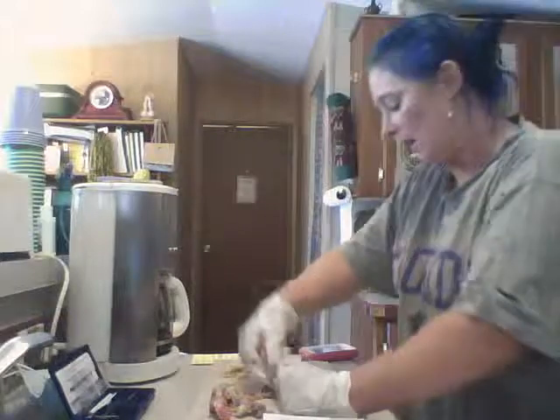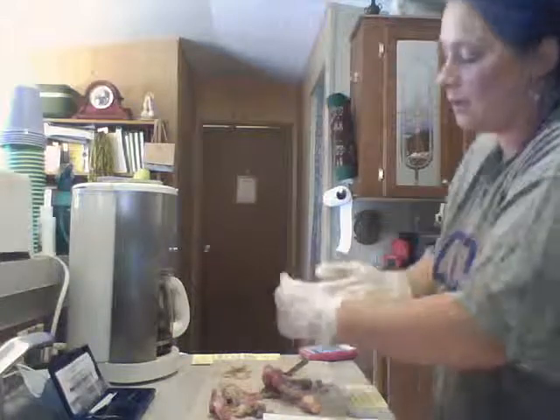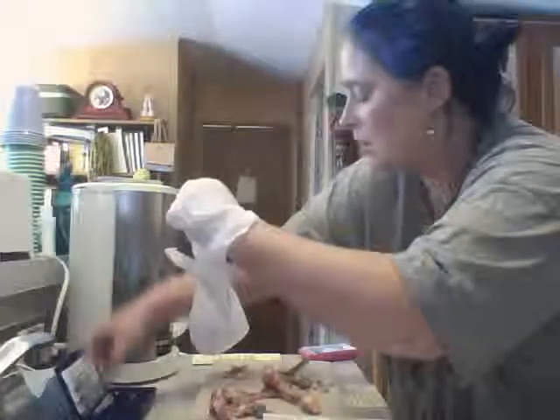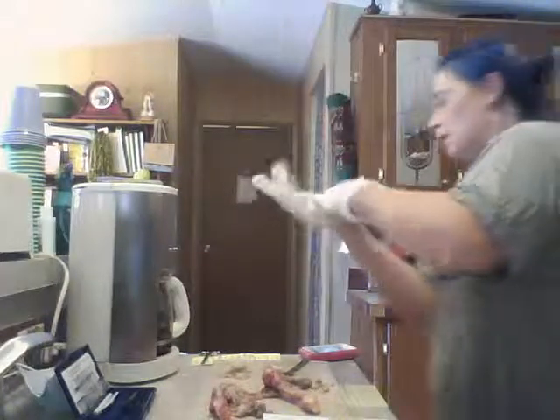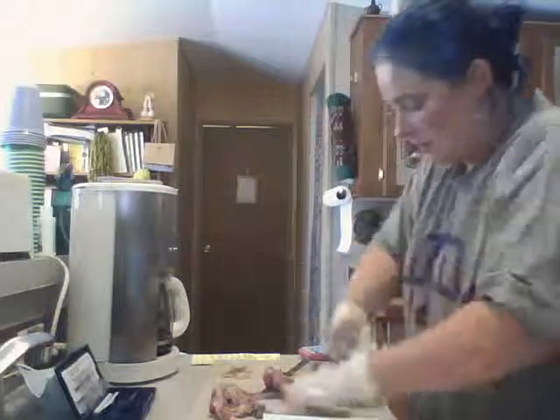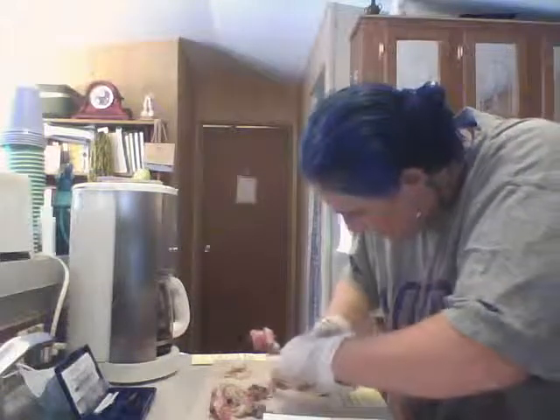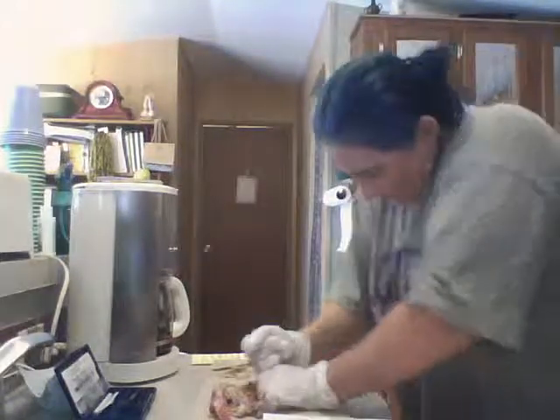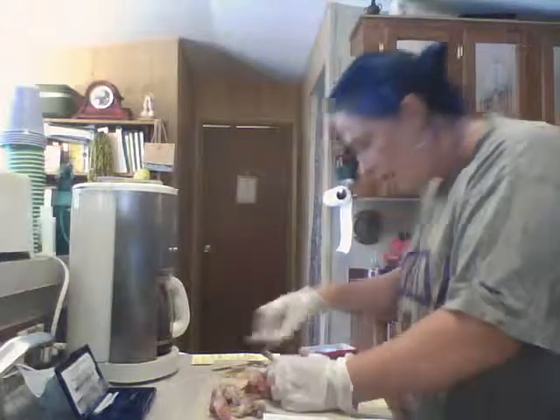Really don't want chicken guts on my book. Let's see. Get some help. Head off.